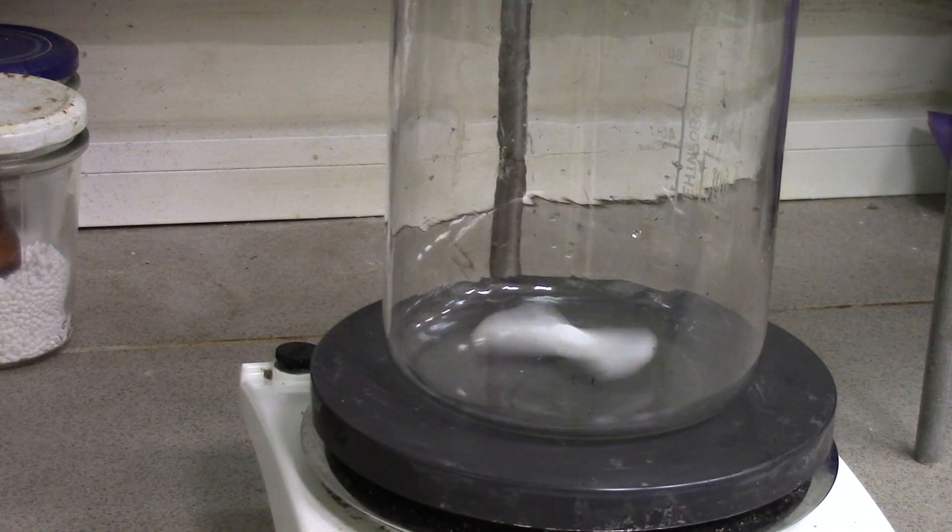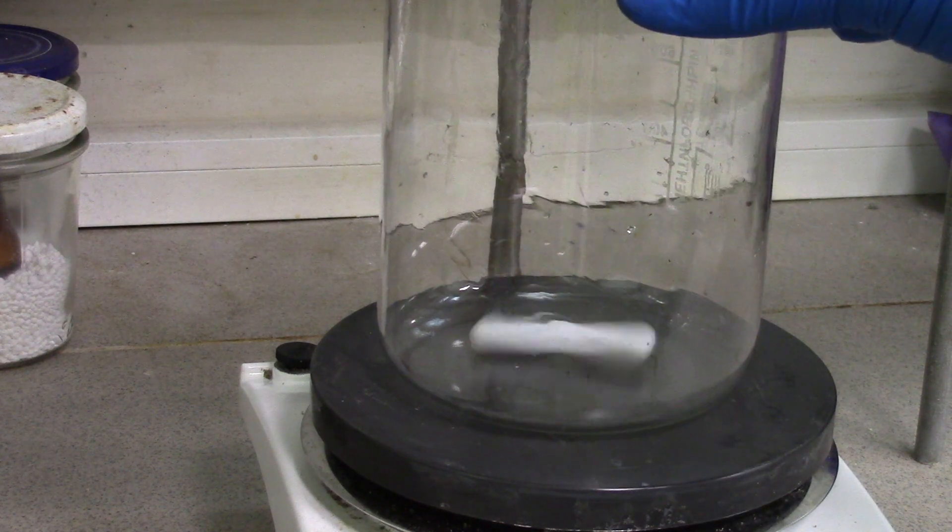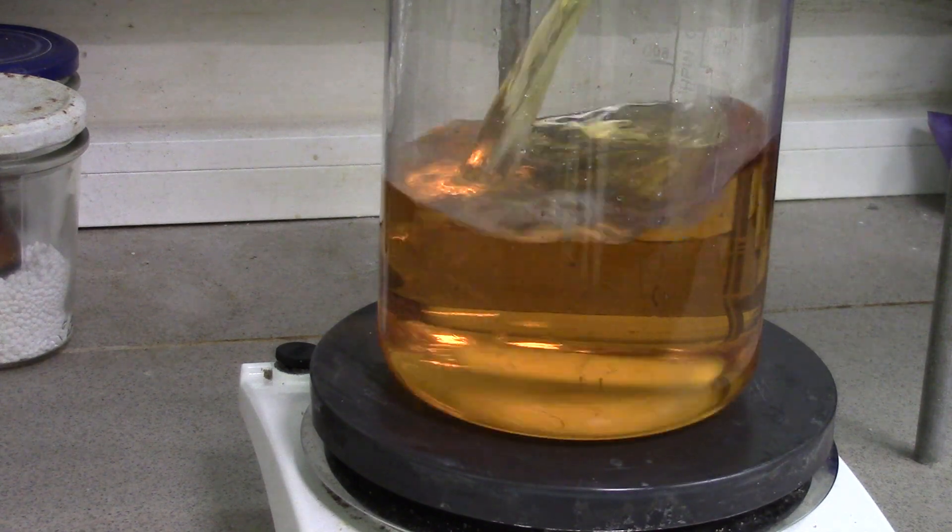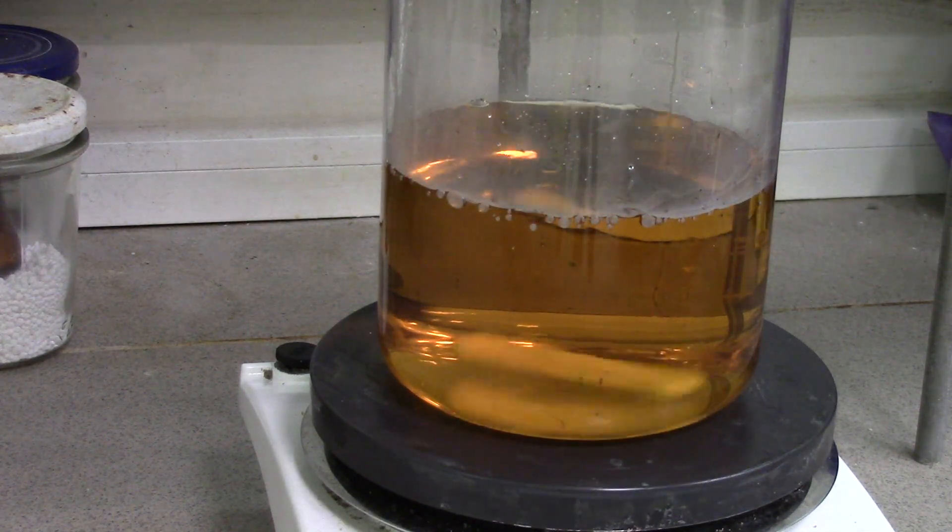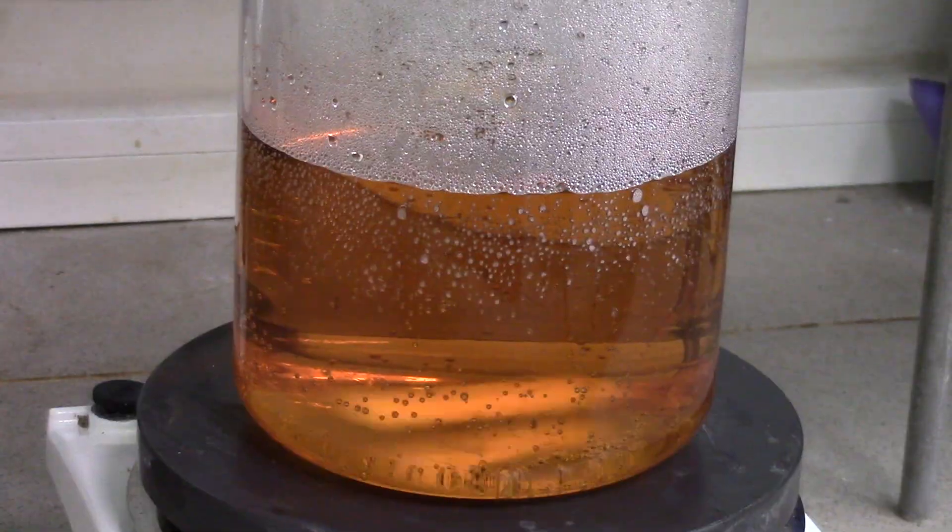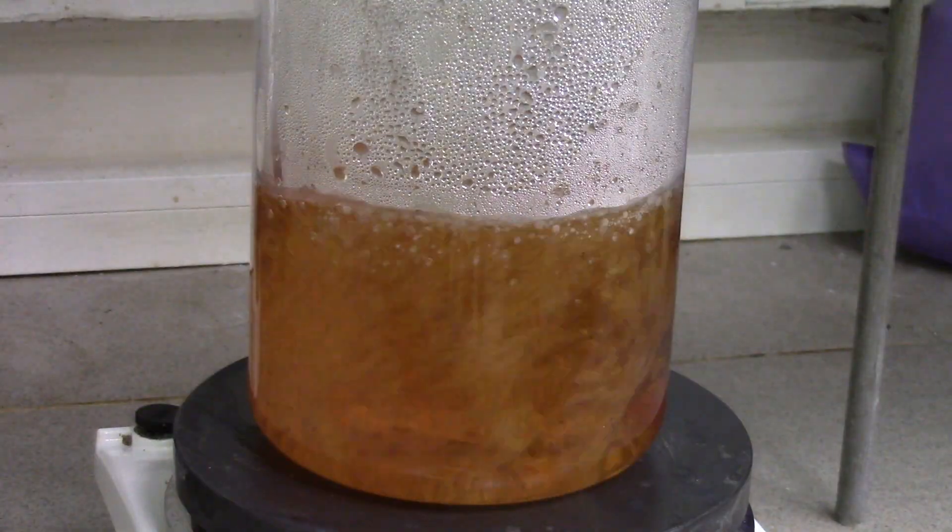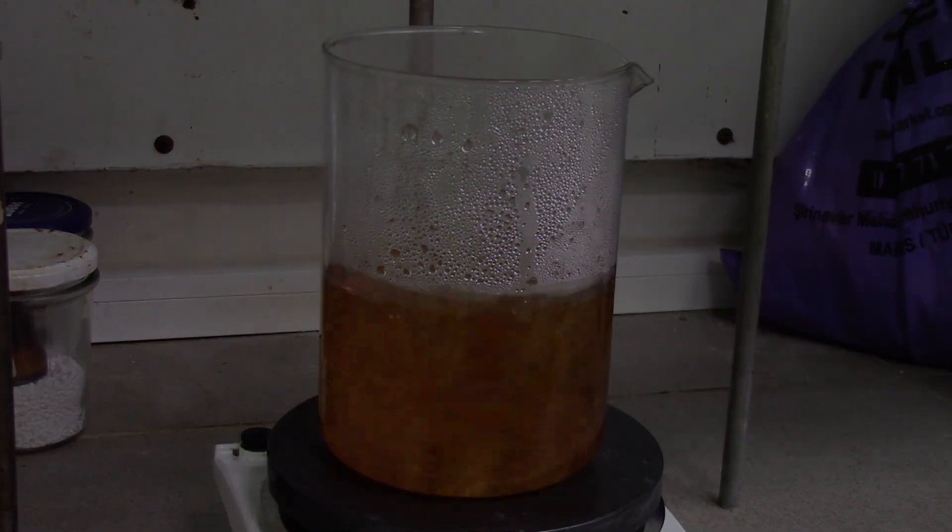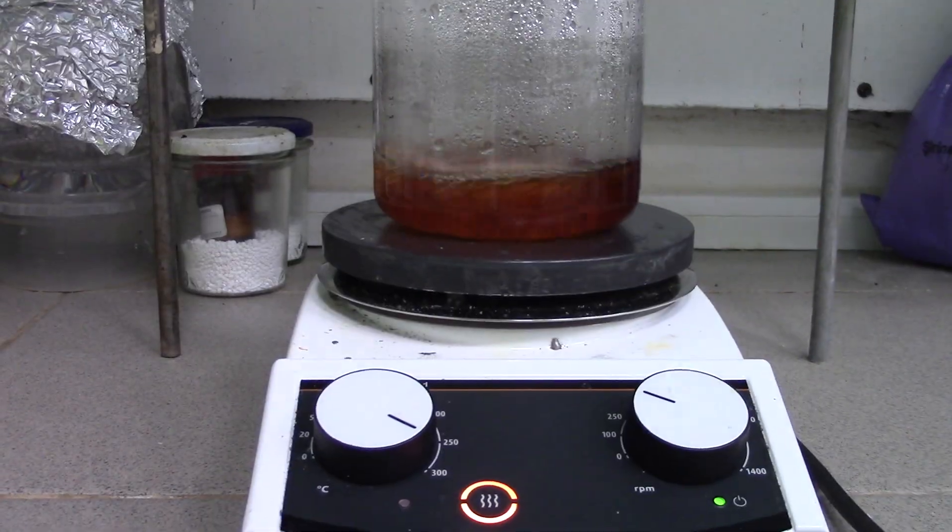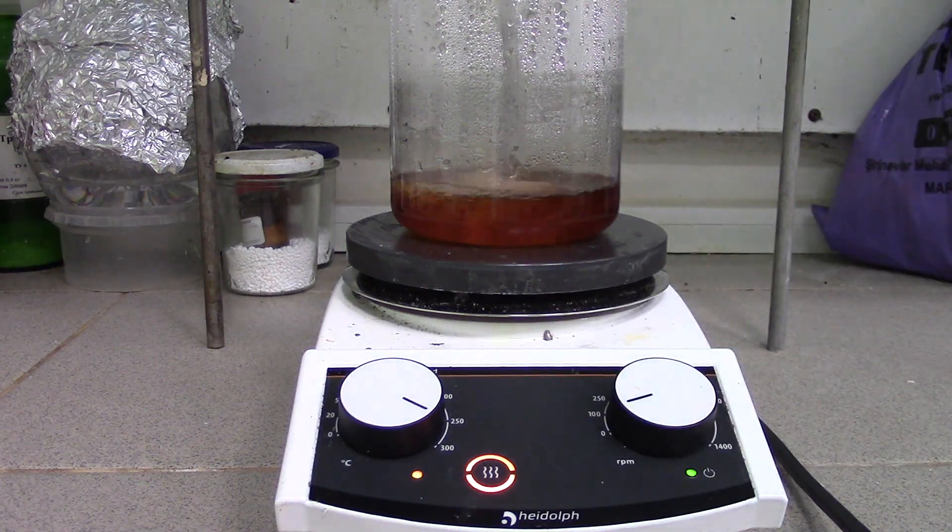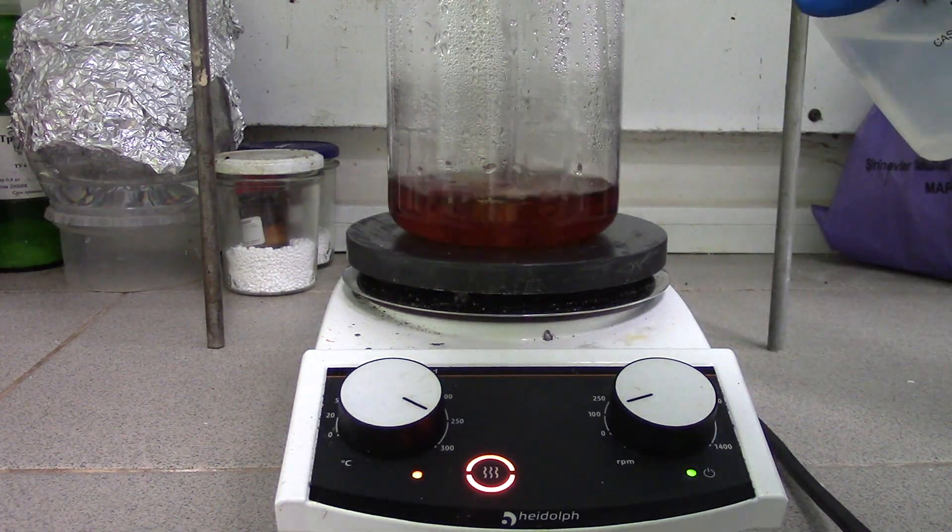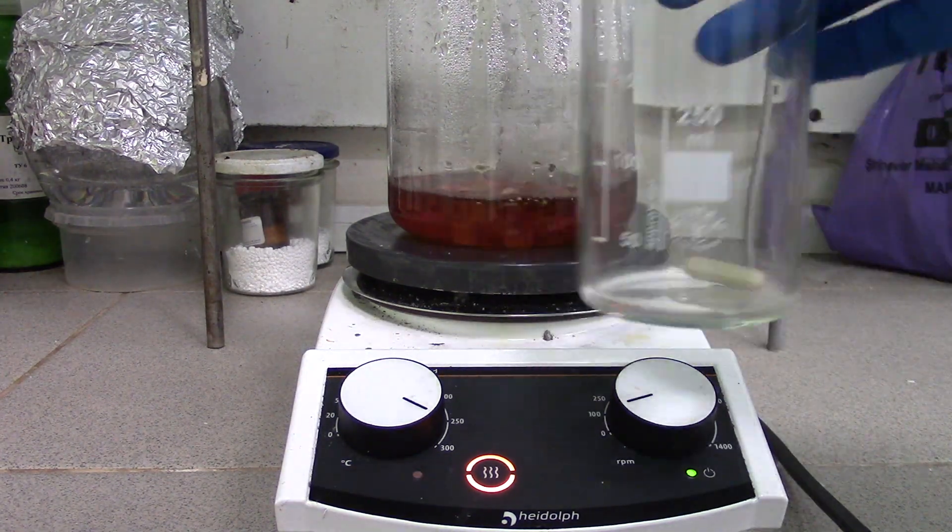Then I boiled off the excess of water from 400 to 50 milliliters at the end of the procedure. At this stage I changed the larger beaker to a smaller one for the further oxidation step.